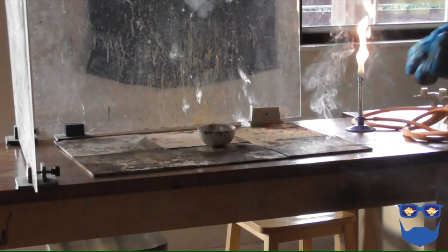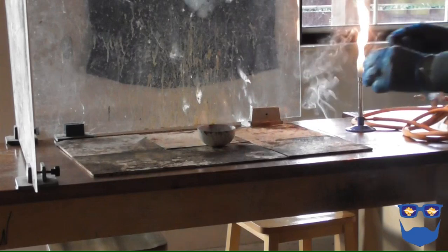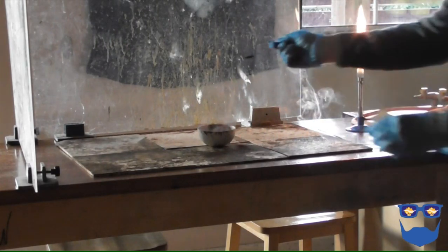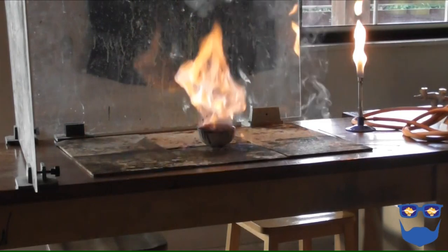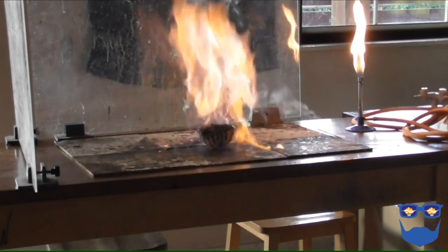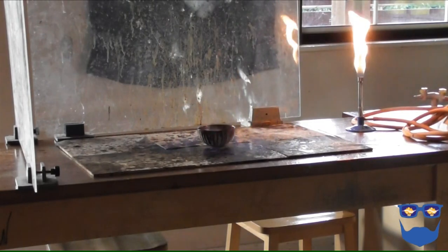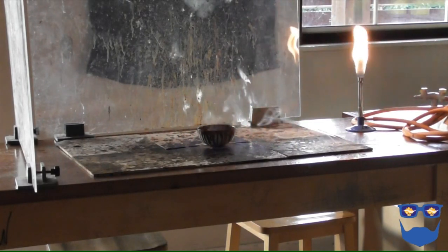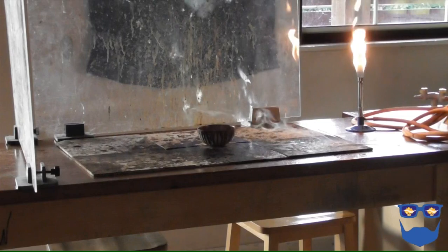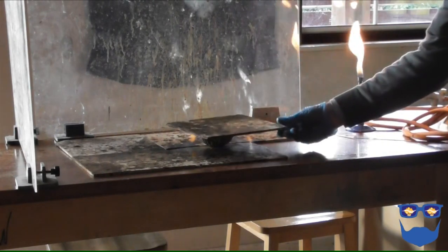Prepare one spatula of the potassium permanganate. In one action, drop the potassium permanganate into the evaporating basin and retreat. Once the hydrogen peroxide is completely decomposed you can return to the bench to extinguish the remaining ethanol.